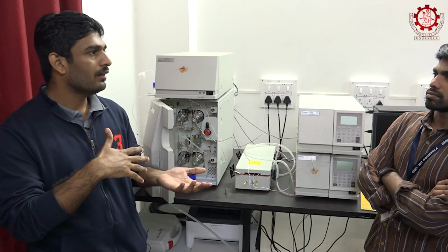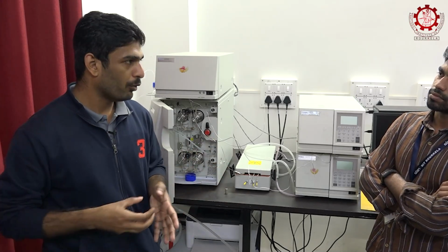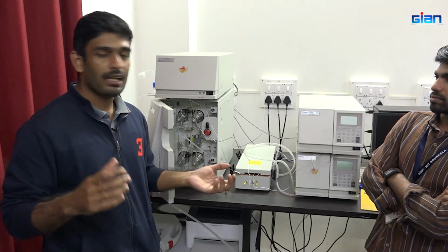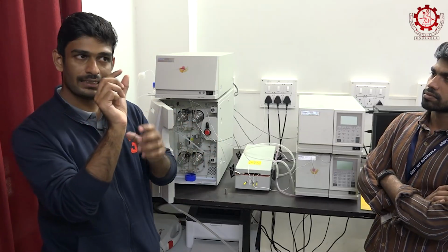After that we will be adding the solvent into it. We can use different solvents, but most probably we will be adding deionized water as a polar solvent. Water is fine, so why go for another polar solvent; acetone can also be used, depending on the sample. Then we prepare the sample, and with the micro syringe we take it out, because there is also a filter. Even any particle from our hand entering the system will completely destroy the column, so we have to be careful while preparing the sample.